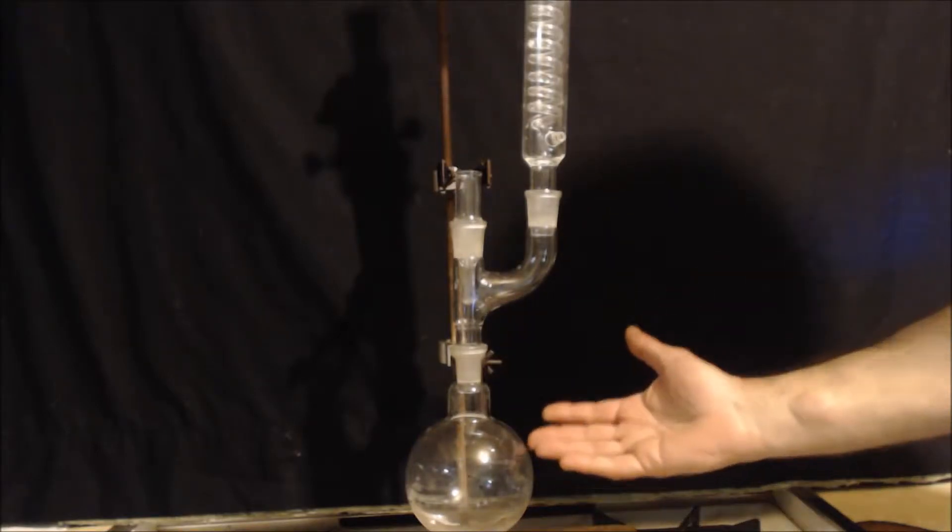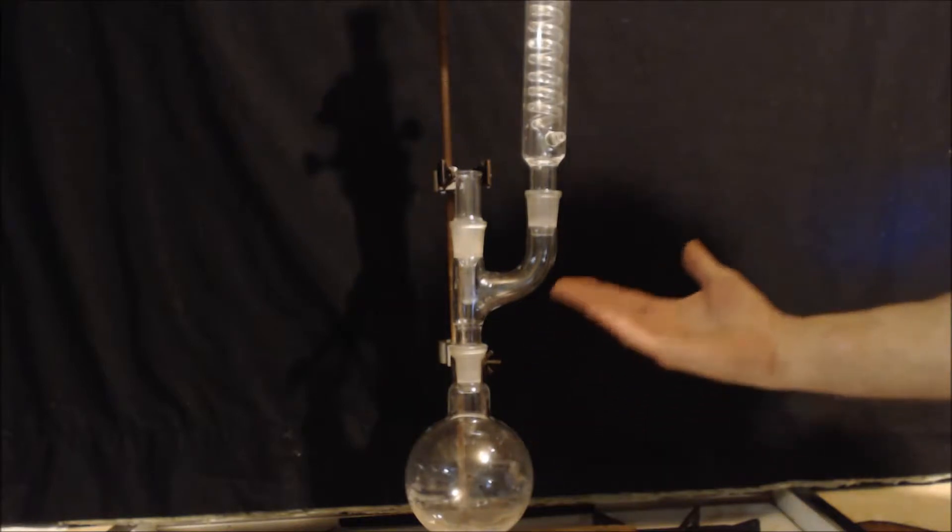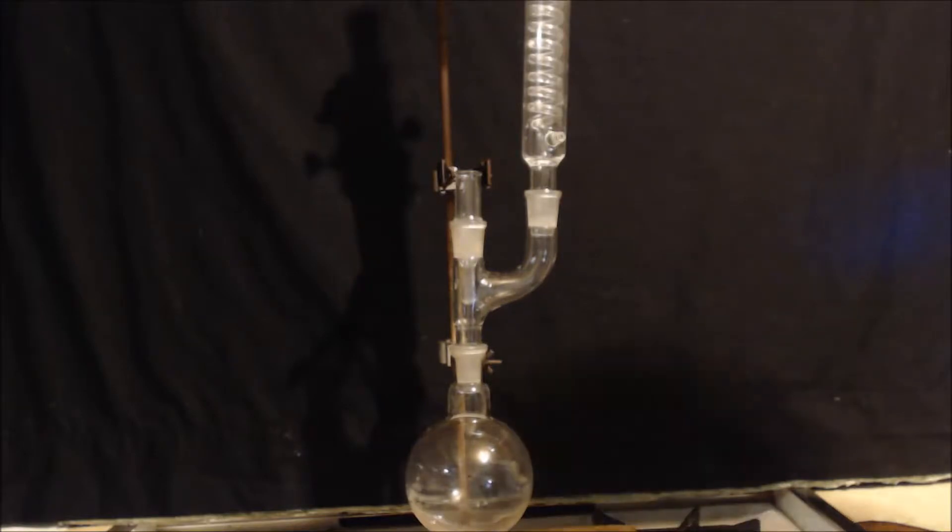That's basically all it is. You're just heating it up as high as you can. And refluxing it means boiling it to where you don't lose the vapors. And I'm going to show you with this apparatus.